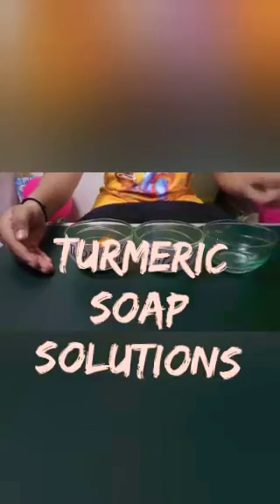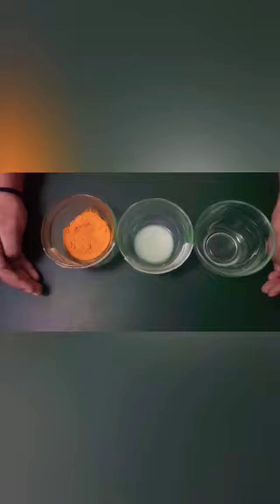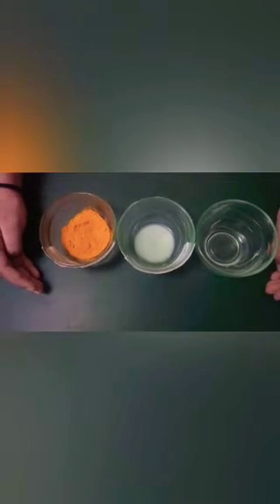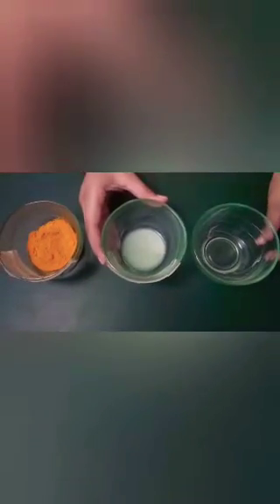Welcome to my YouTube channel Tanmay Classes. This is a soap solution experiment. Friends, the same experiment of observing the color change of turmeric is now repeated with soap solution.